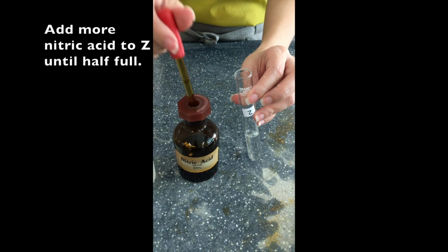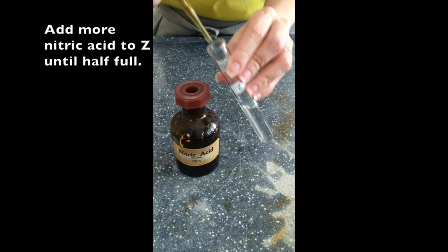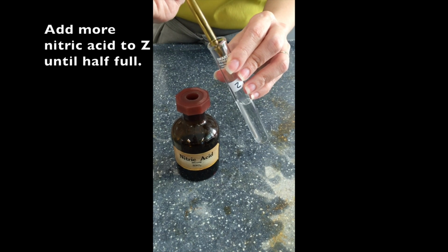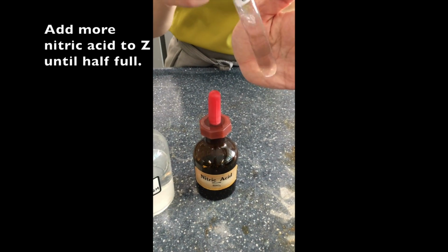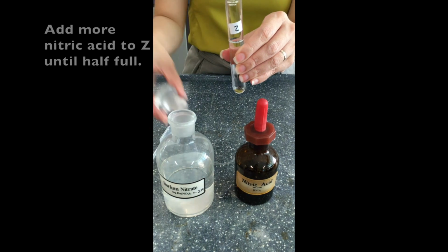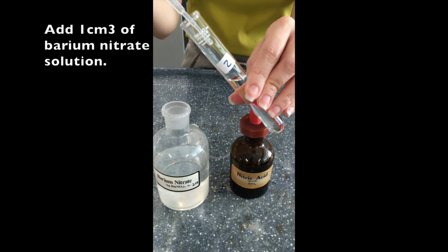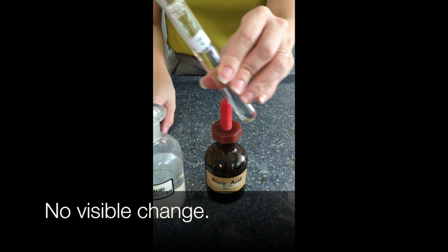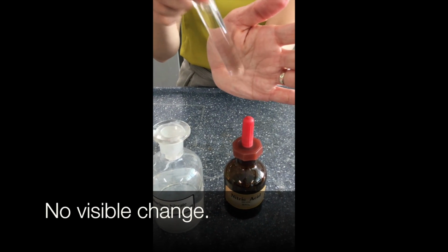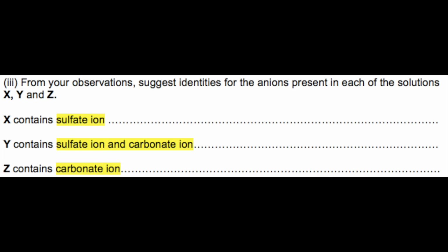Finally, for Z, we add more nitric acid until half full again. And in this case, you can see that there is no visible change. Followed by barium nitrate, which is about 1 pump, and you can see that there is no visible change here at all. So therefore, from these observations, we can tell the following.